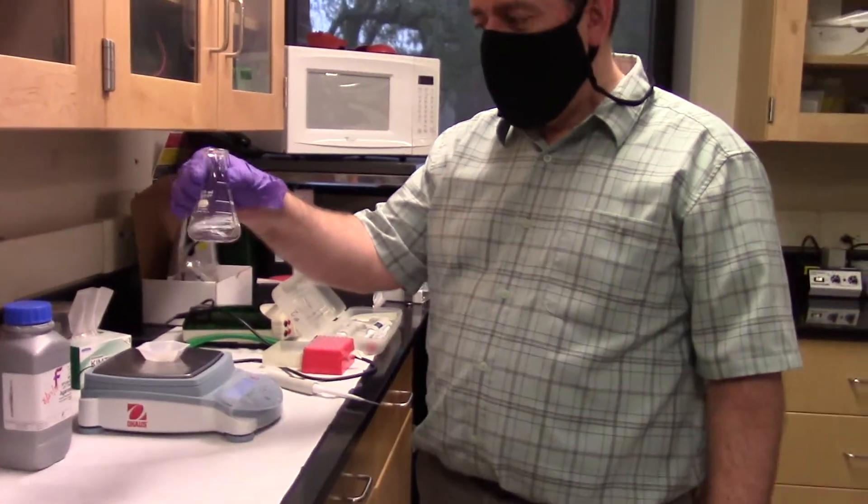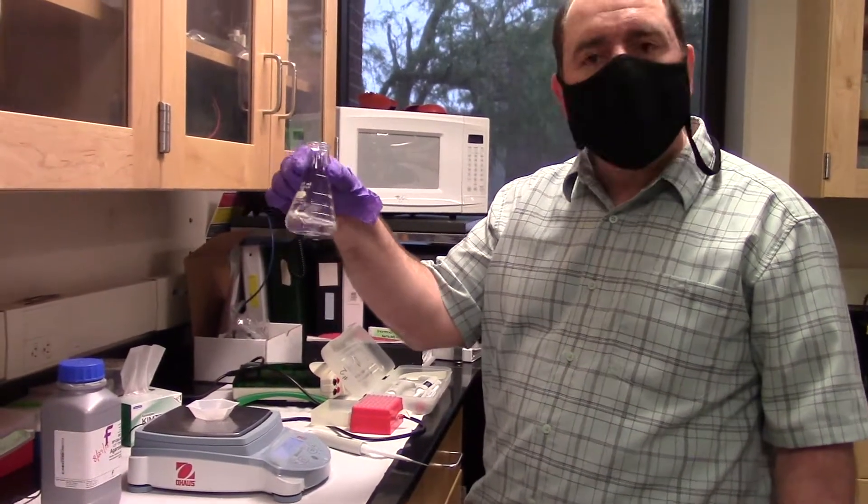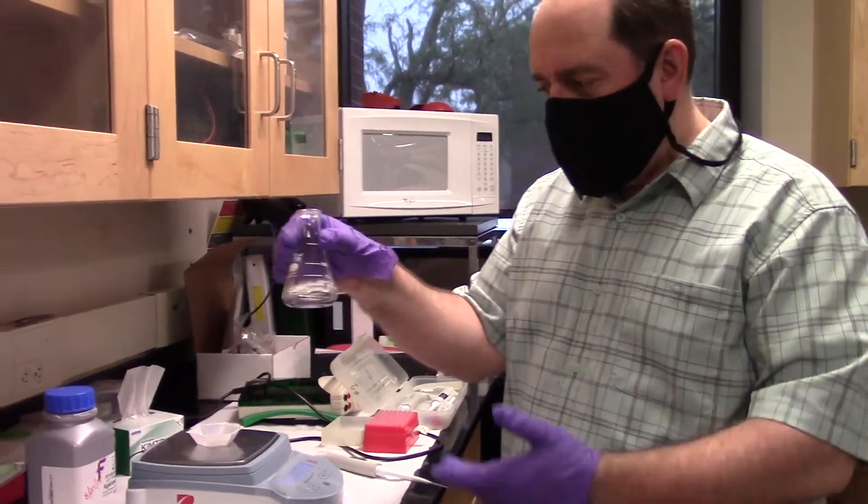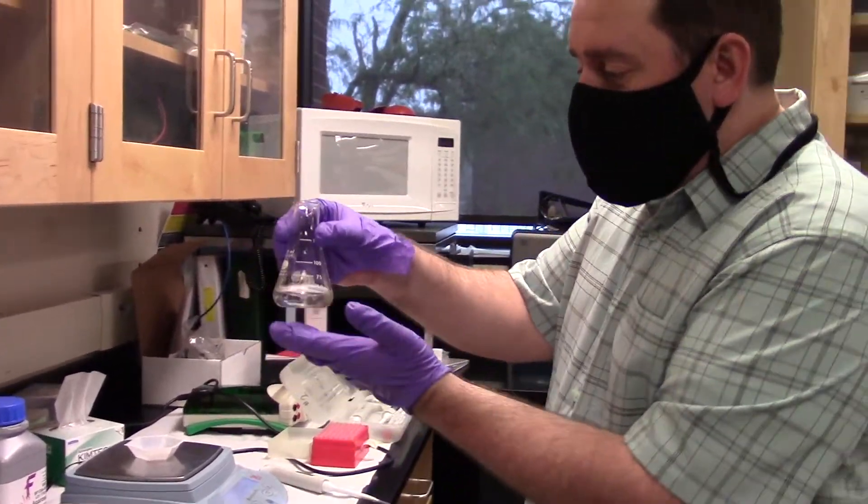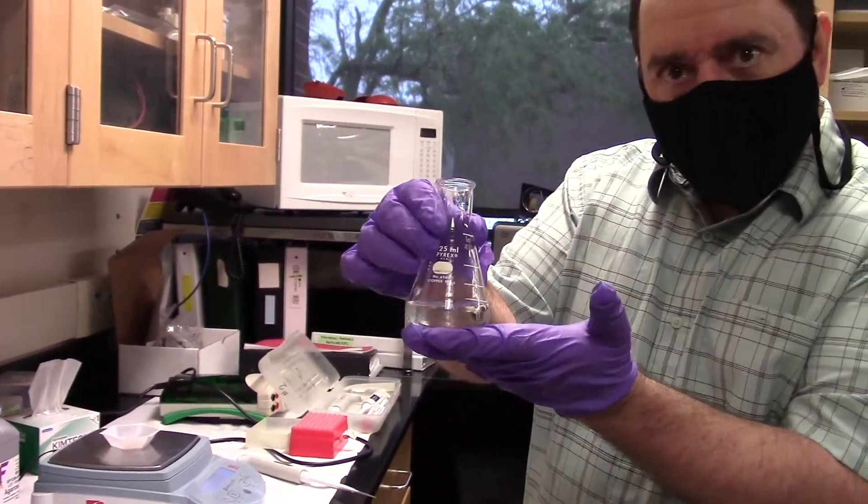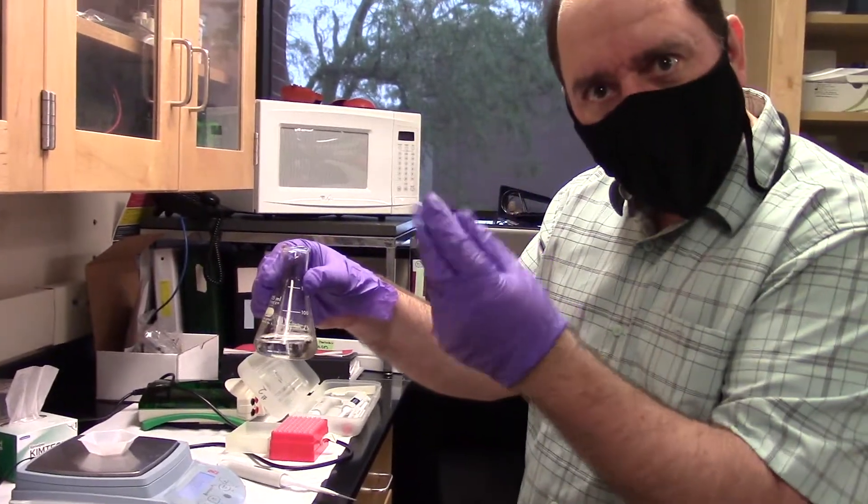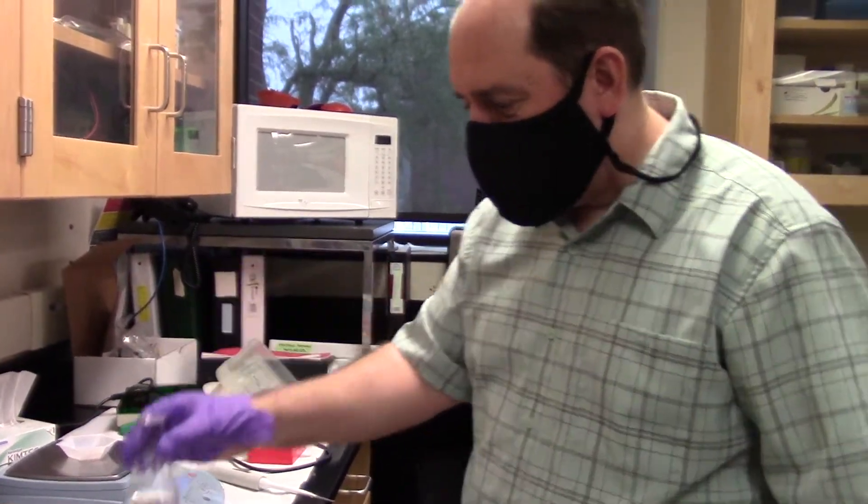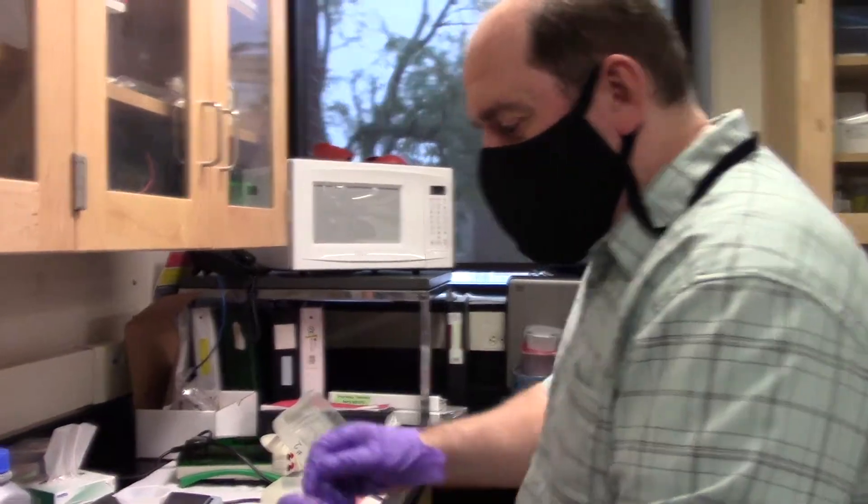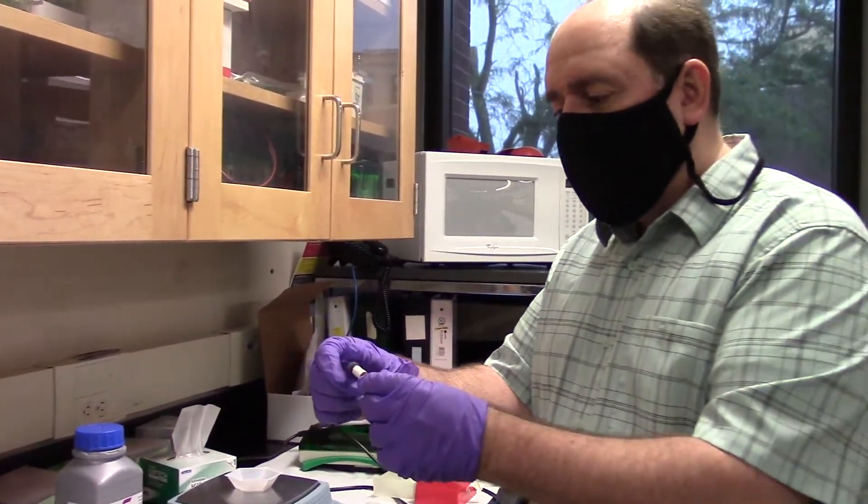So here's our melted agarose. It is still completely liquid. I do not wait long enough for it to solidify and cool. It's just cooled enough that I can hold it without burning my fingers. So it's no longer boiling. At this point, I can add our fluorescent dye.